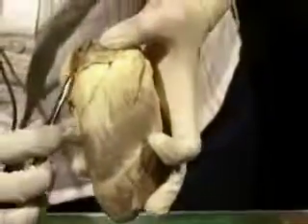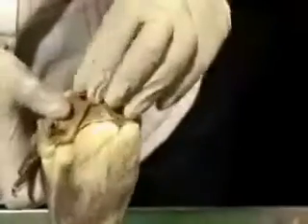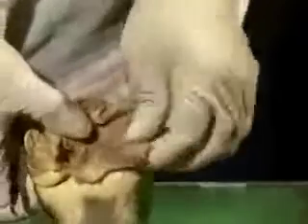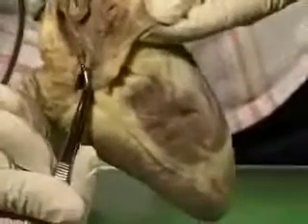And what I did is I made a slit right through so that I could open up the right atrium, and here you can see it opened up. See how most of it is smooth, and then where the auricle is, you can see it has this rough part which we call the musculi pectinati. So you can see this thing looking like the teeth of a comb, so that's why it's called the musculi pectinati. So here is the inferior vena cava opening, here is the superior vena cava opening.